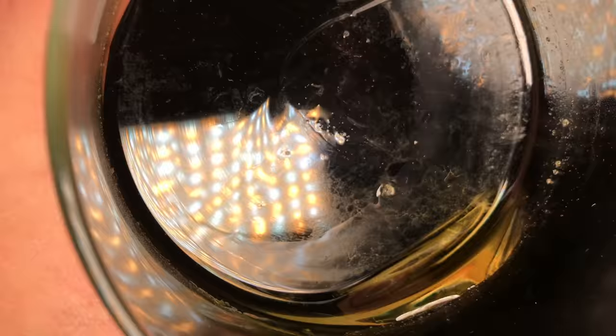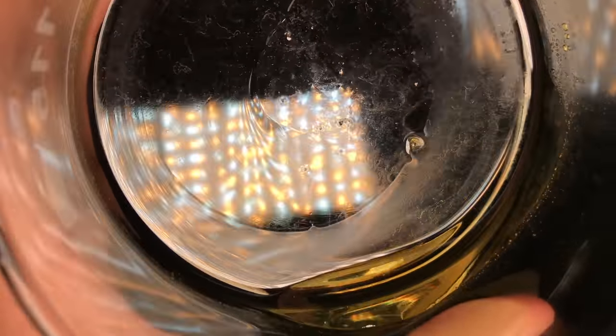Even after that, it did not want to solidify and it looked like this. I got it tested in a lab, and this weird oil contains about 46% of our product. There is also some sort of ester which the product made with itself, and this is likely why this stuff is still liquid.